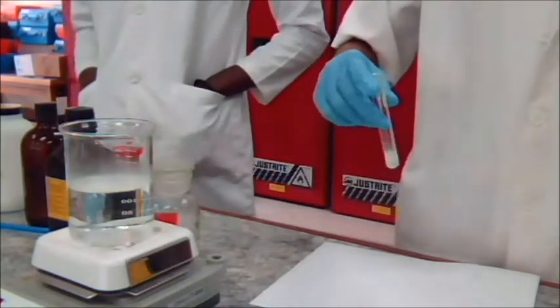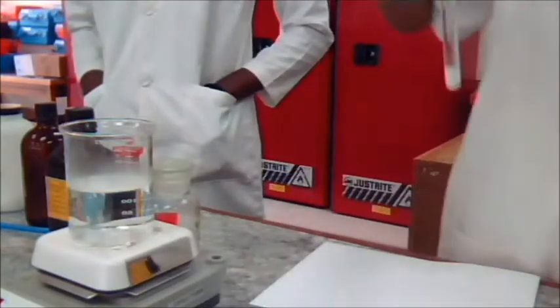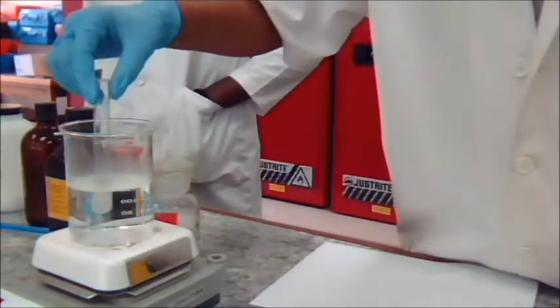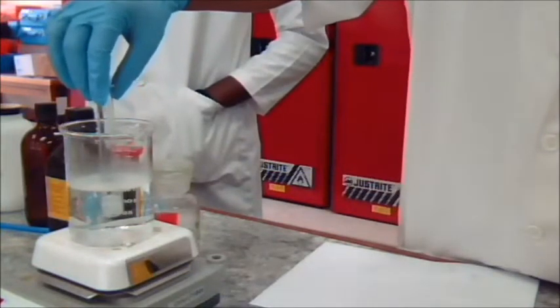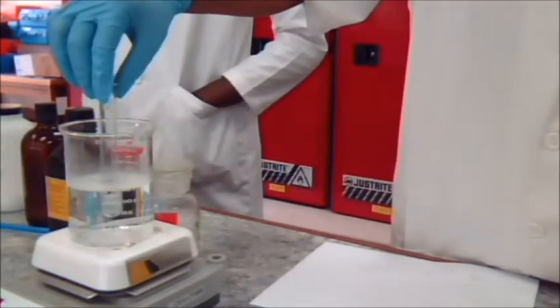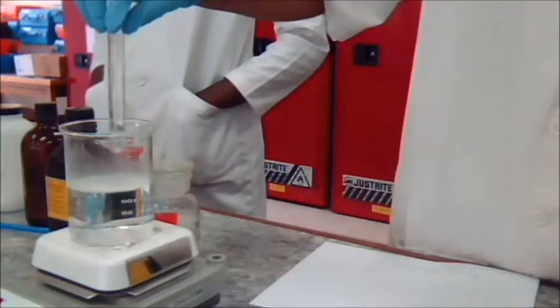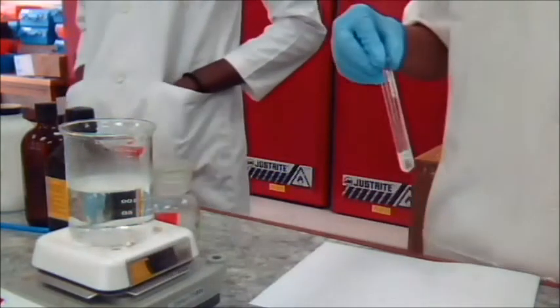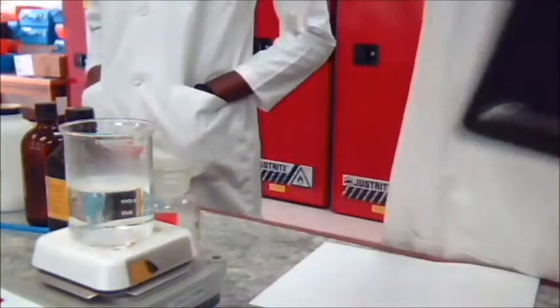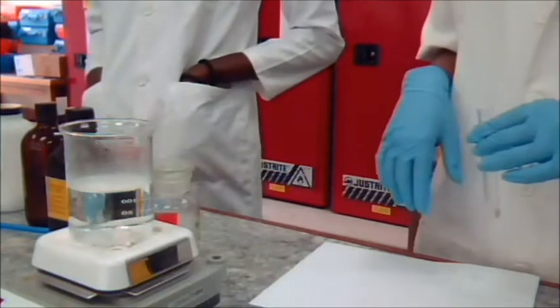If no sign of a reaction is visible in 3 minutes at room temperature, warm the mixture in hot water. To ensure that the precipitate is a silver halide and not the salt of a carboxylic acid, we're going to add 0.5 milliliters of 6 molar HNO3 to the solution with the precipitate.